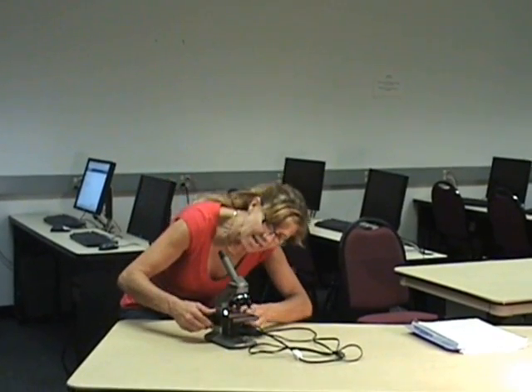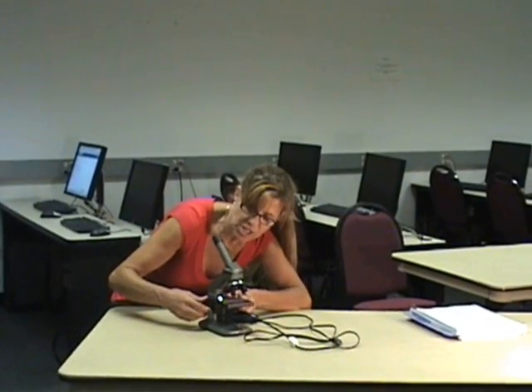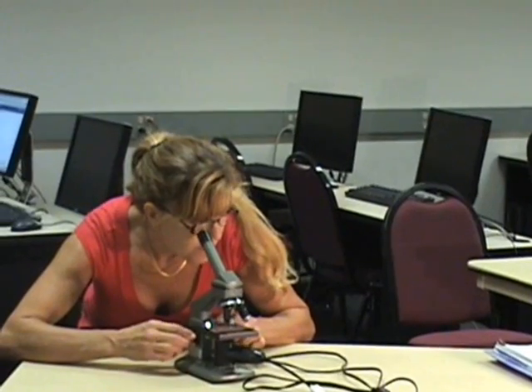You can then, from the side, take the focus bar and bring your stage up a bit, and then look through the lens and focus even more. After getting it in focus, you can switch to a higher objective to get a closer view of your specimen. Always return to the lowest objective when you are done and before removing your specimen. That's all for today — I think you're ready to start some beginning exploring with your microscope. Thank you.